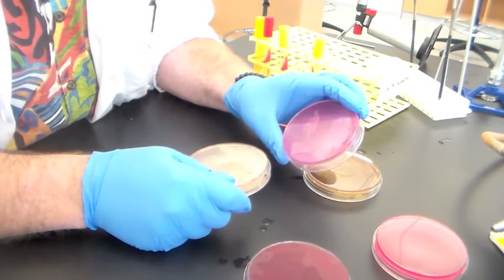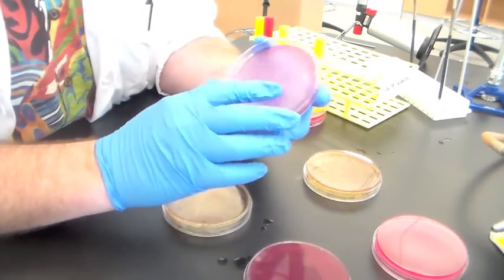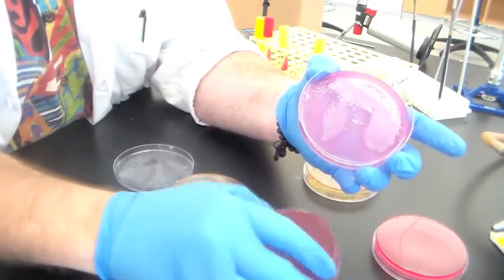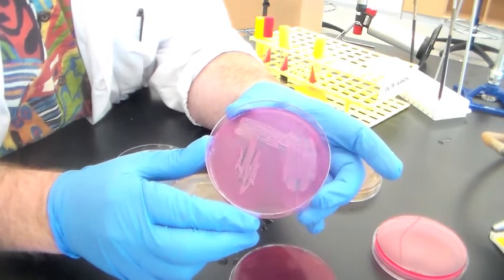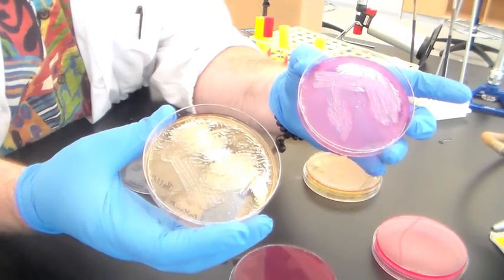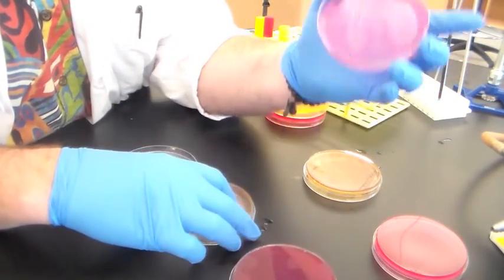I prefer MacConkey agar to EMB because it has only lactose in it, so there's no confounding worry about sucrose. It's differential because when the bacteria you've inoculated is capable of fermenting lactose, it turns acid, creating an acid condition. You get a nice pink color. So it's very easy to differentiate between a lactose fermenter and a lactose non-fermenter, which will also grow if it's a gram-negative bacterium, but won't cause the pH indicator to turn pink.